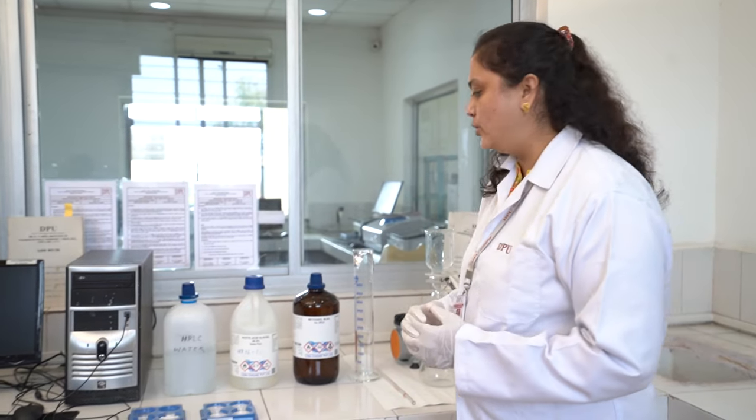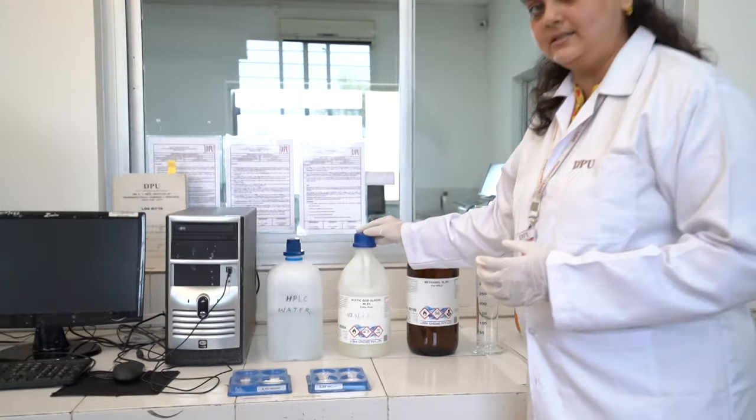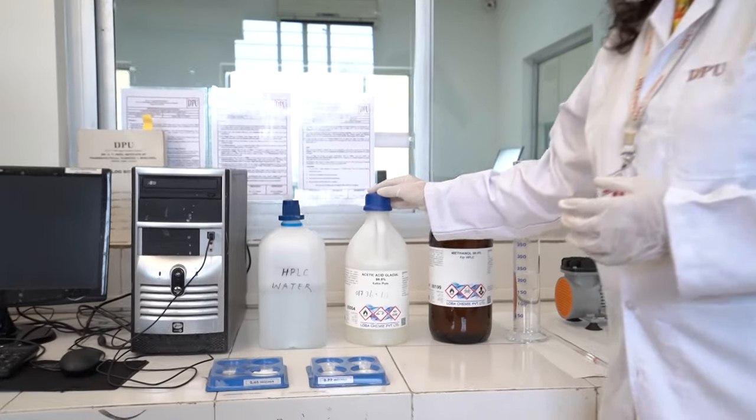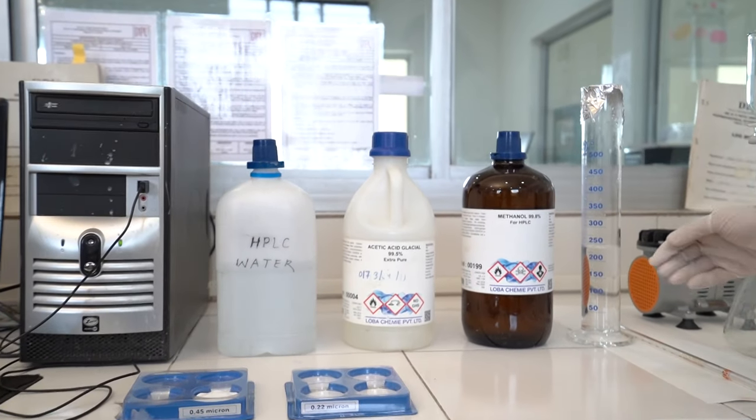First is mobile phase preparation. The optimized mobile phase for paracetamol assay is 40% volume by volume of methanol and 60% volume by volume of double-distilled water with 0.1% glacial acetic acid. We will now transfer the methanol and water.